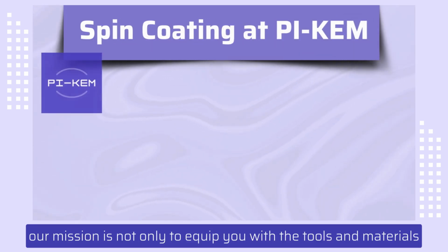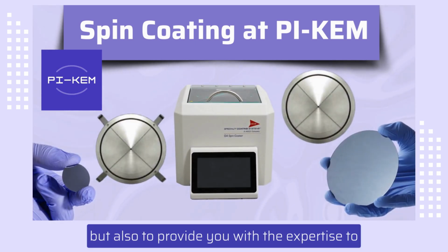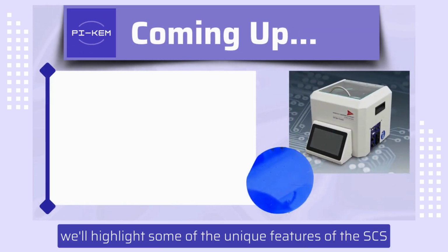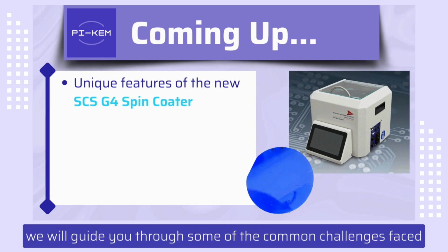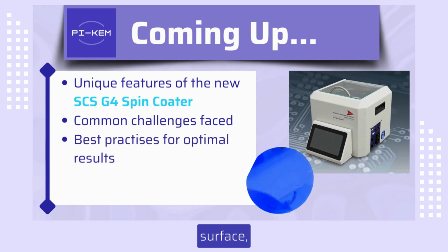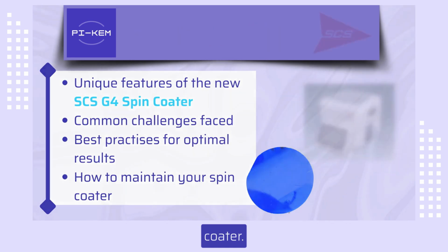At PI-KEM, our mission is not only to equip you with the tools and materials that are central to your research, but also to provide you with the expertise to maximise your equipment's potential. In this short video, we'll highlight some of the unique features of the SCS G4 Spin Coater series. Using the G4, we will guide you through some of the common challenges faced when spin coating, techniques for optimising the quality of your spin coated surface, and maintenance tips to help you get the most from your spin coater.